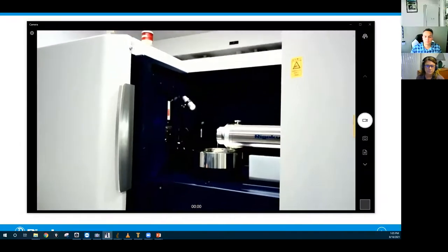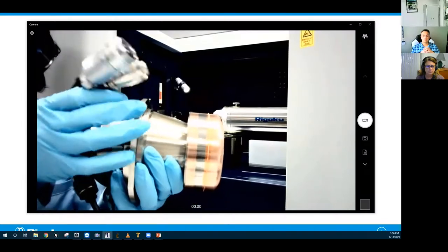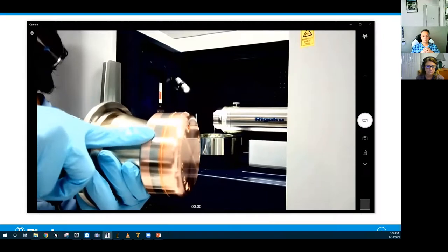Now I'm gonna put the camera down and show you the anode. So we use this rotating anode X-ray generator so that we can put high power on, which is 1200 watts, without melting the anode, so that you can get a lot of X-ray photons. And the anode itself looks like this. It's quite heavy, but so this is the copper target or the cup.